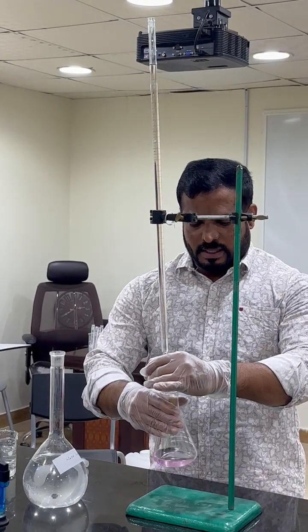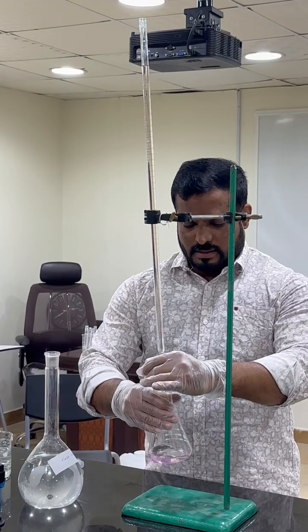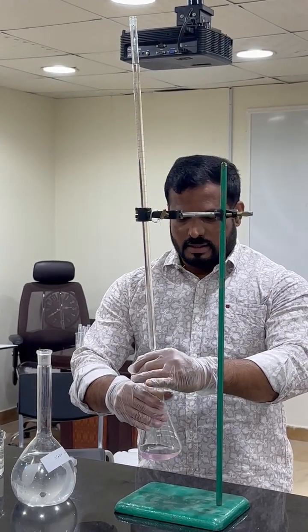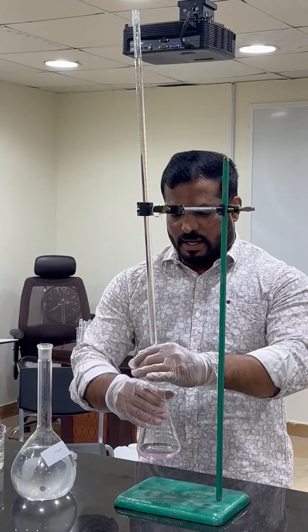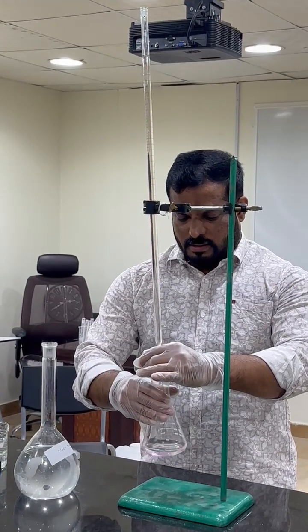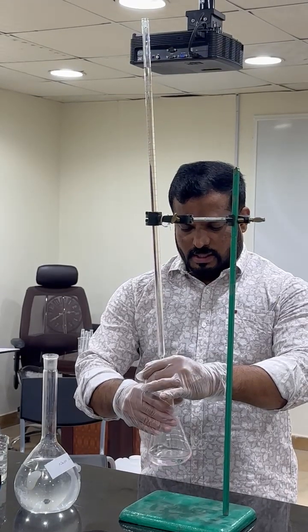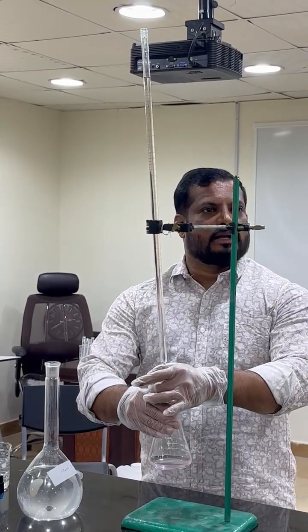Still you can see the color. Now almost the color fades, so then you want to be careful here. Drop one. Drop two. See, now the color changed completely.